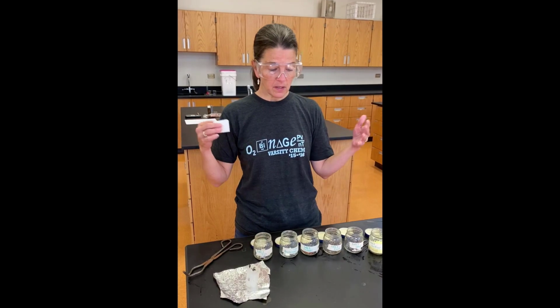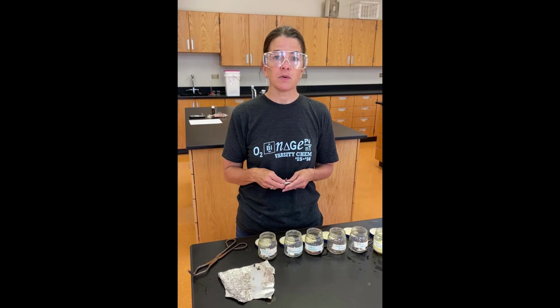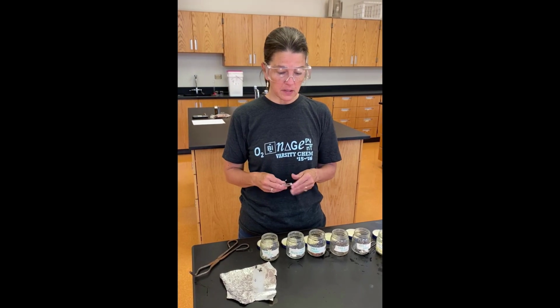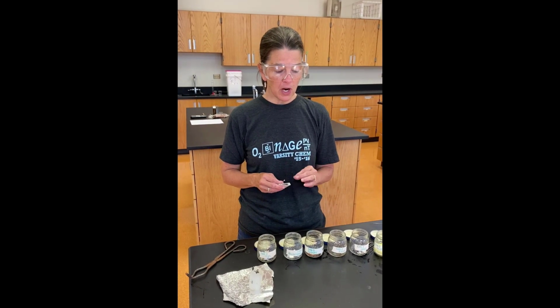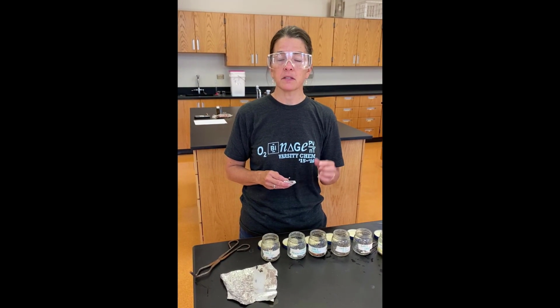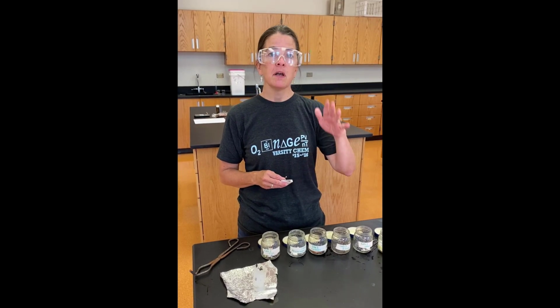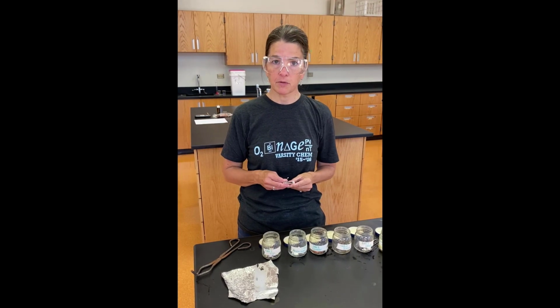Okay, so in the last lab you learned about how to do observations, and today you're going to work on doing observations for a purpose. And the purpose here is I have 7 different materials, and your job is to figure out the sequence of melting points. So which one melts at the lowest temperature, then the next lowest temperature, and so on up to which one melts at the highest temperature.